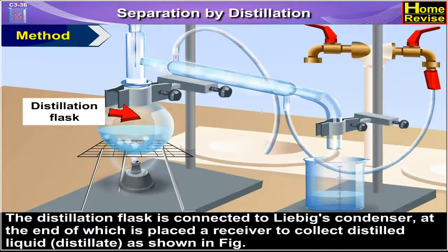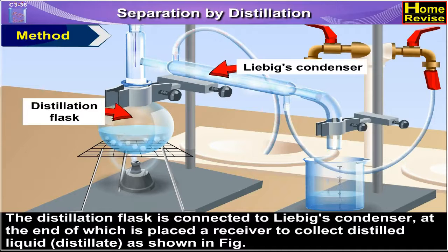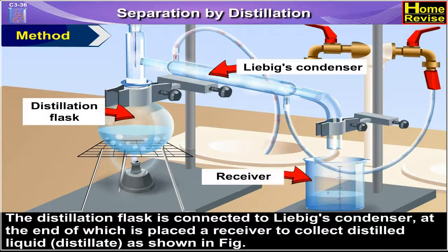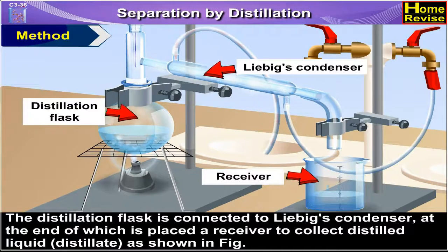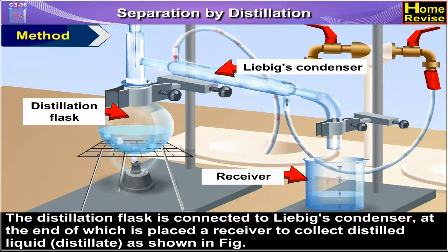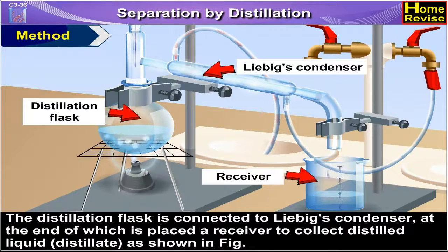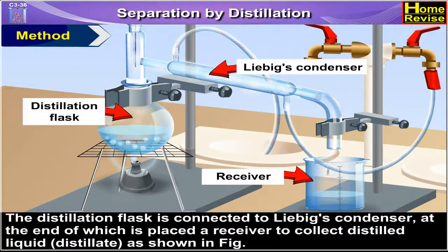The distillation flask is connected to a Liebig's condenser, at the end of which is placed a receiver to collect the distilled liquid — that is, the distillate — as shown in the figure.